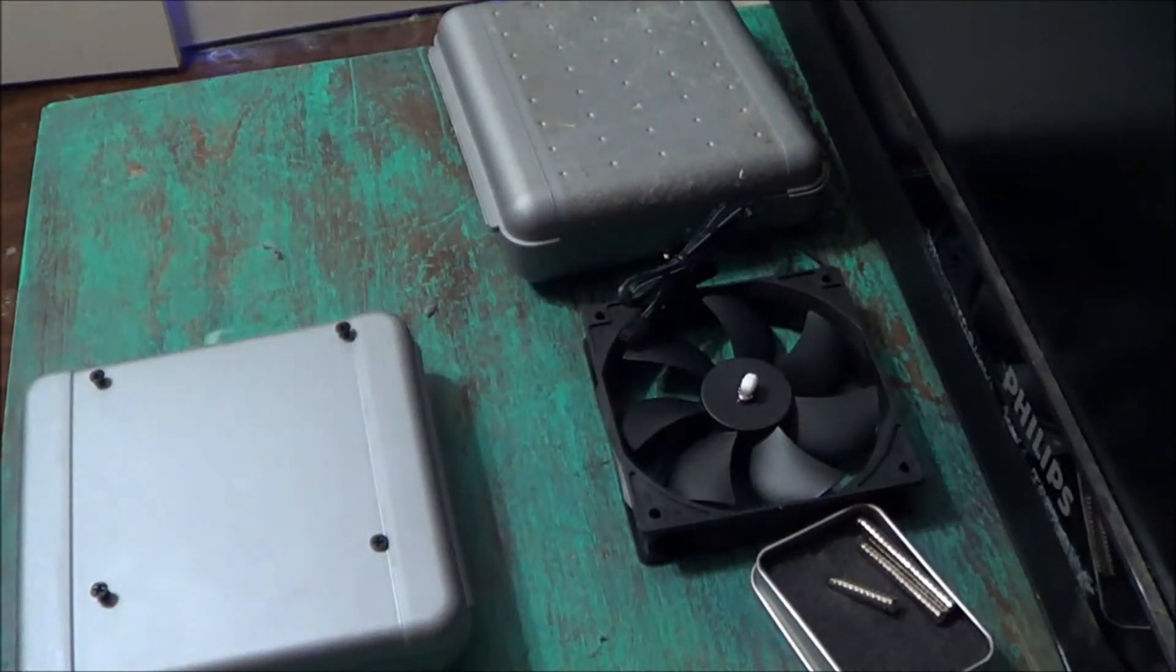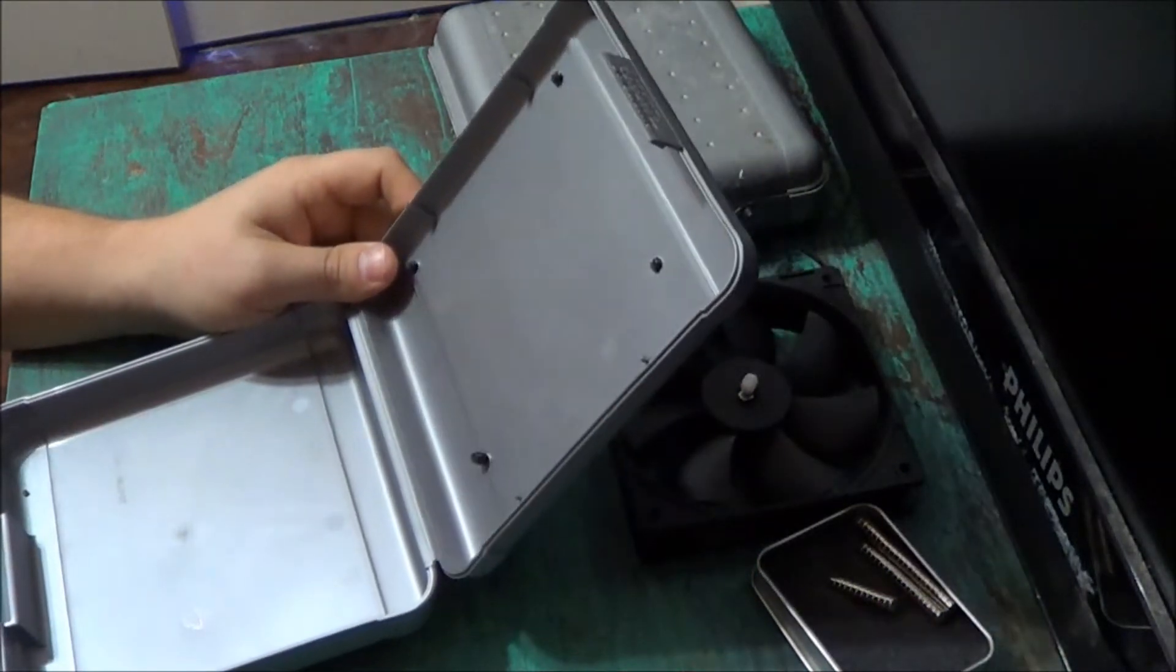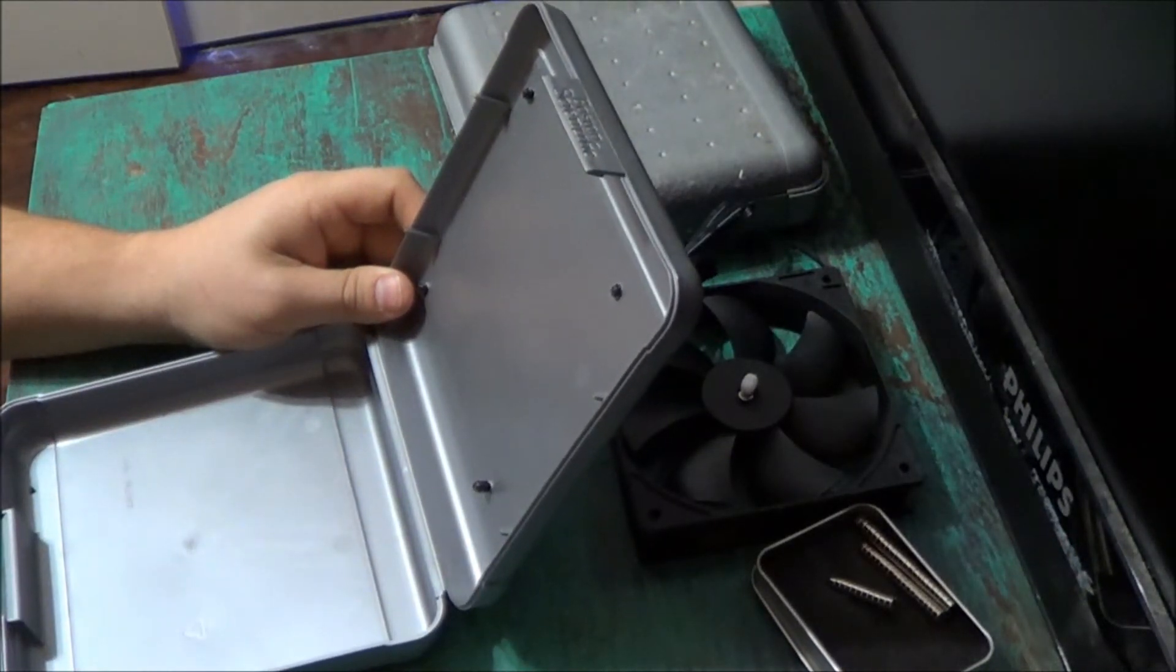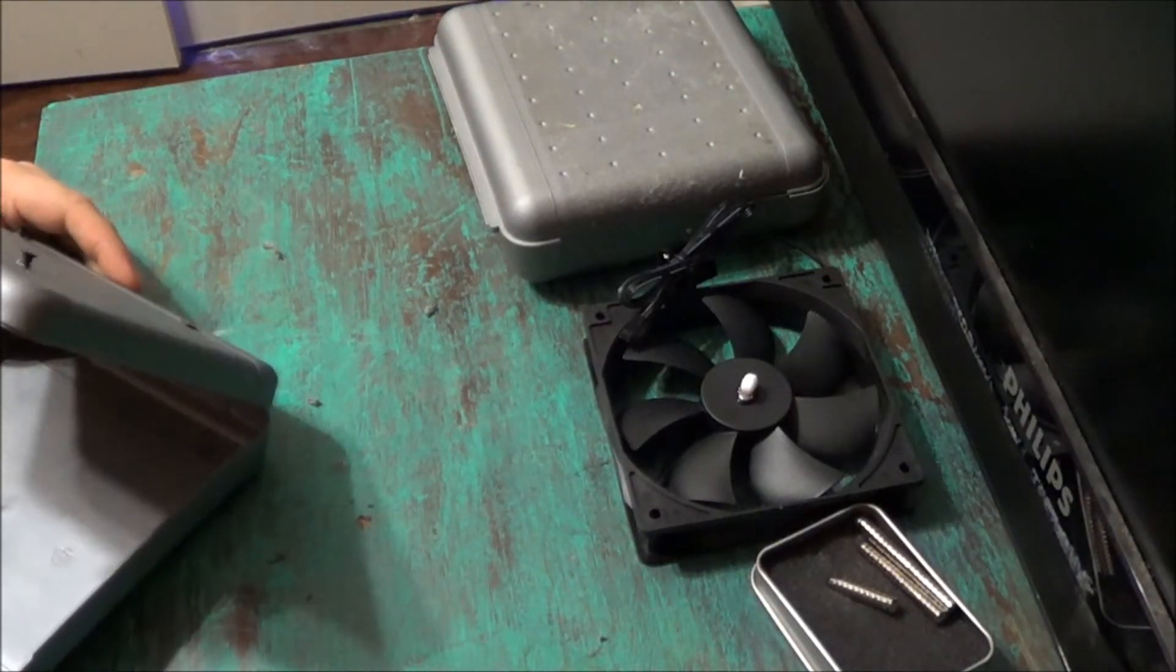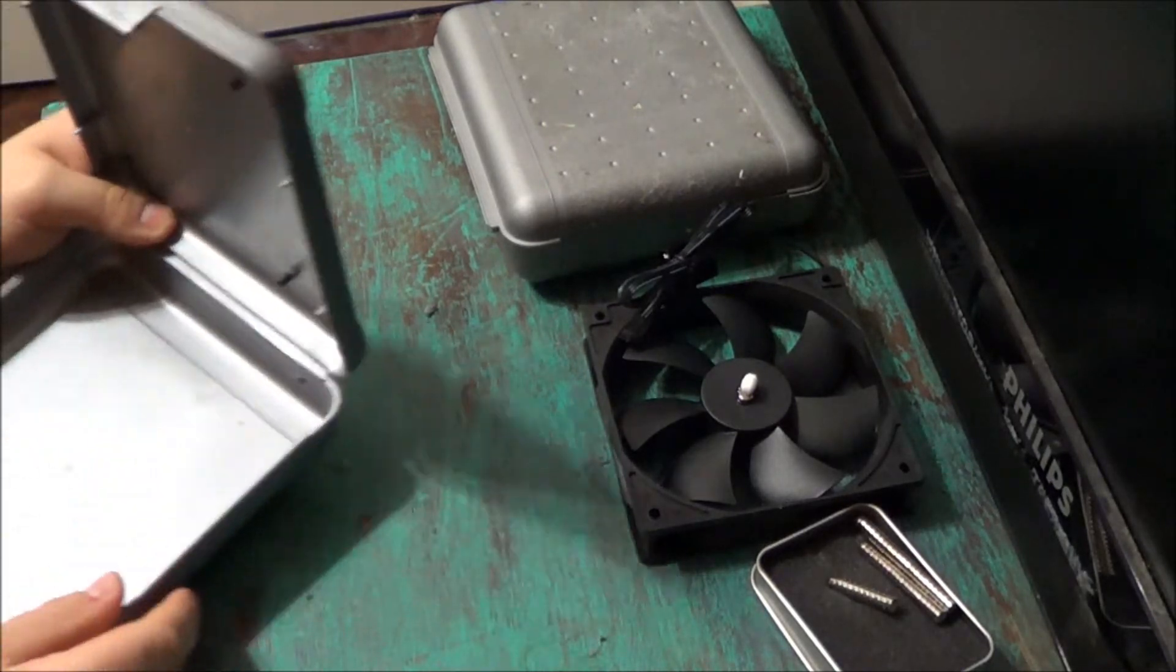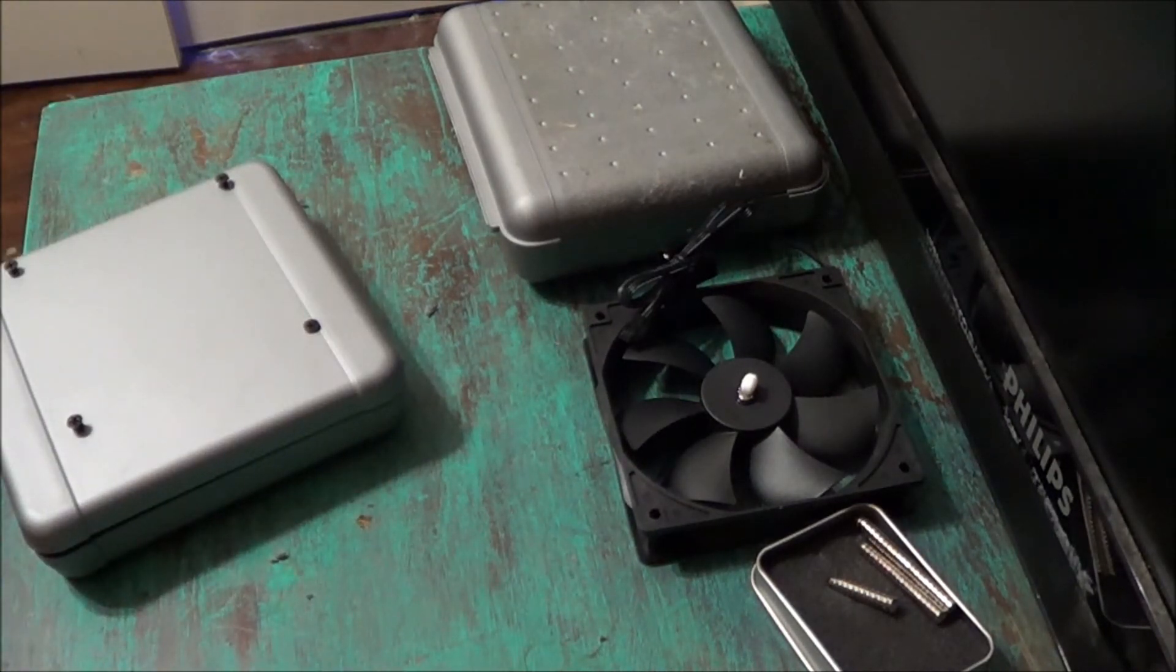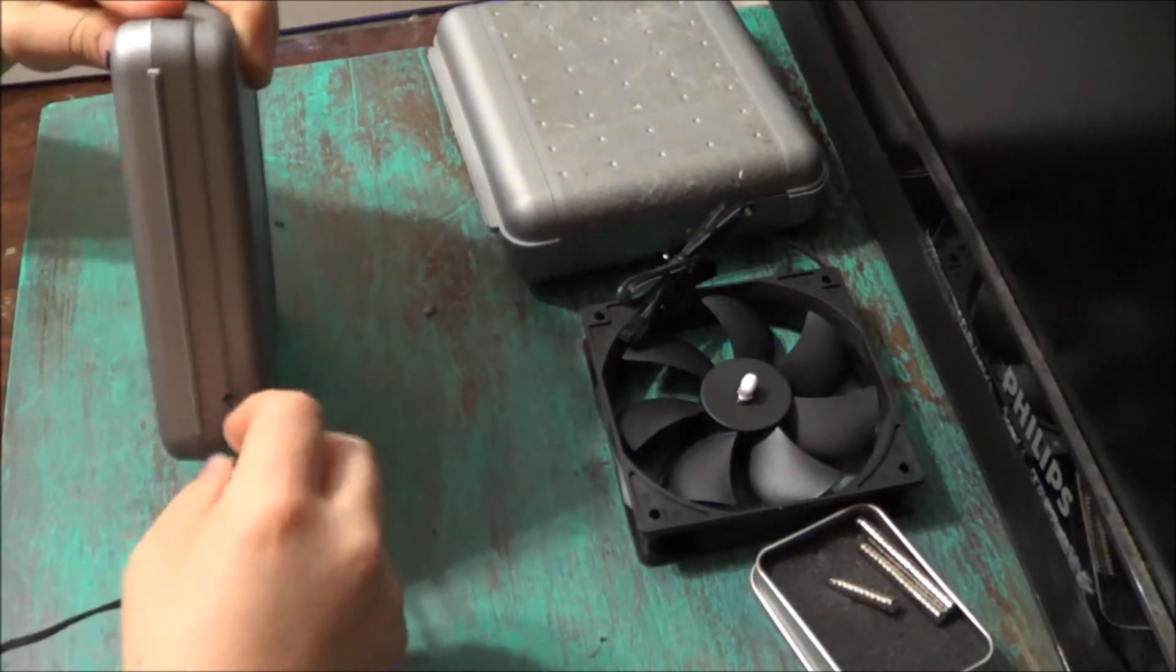We'll pick back up our box again. Now we're going to drill the hole so we can run our power supply on the inside. And again, I'm just going to use the same drill bit that I used to drill the holes for the mounting screws. Now you want to be careful with plastic too, that way you don't over push the drill through and crack the plastic. I'm going to take my power supply, I'm going to run it through that hole that I just drilled. Just like that.